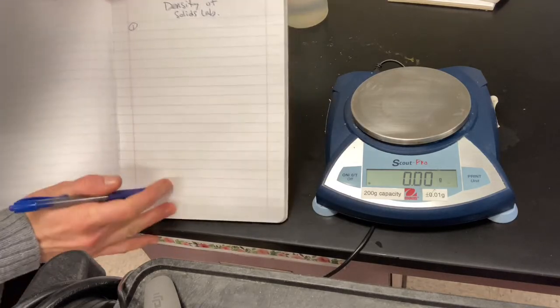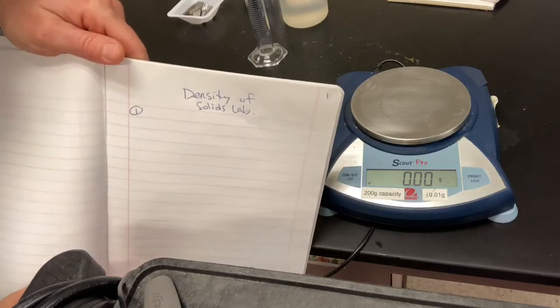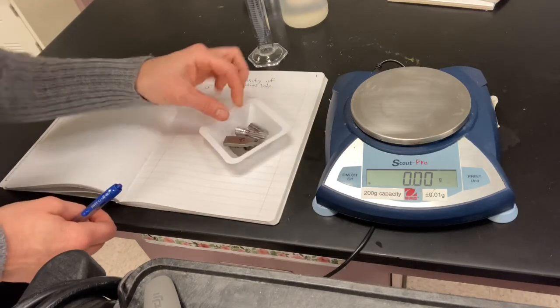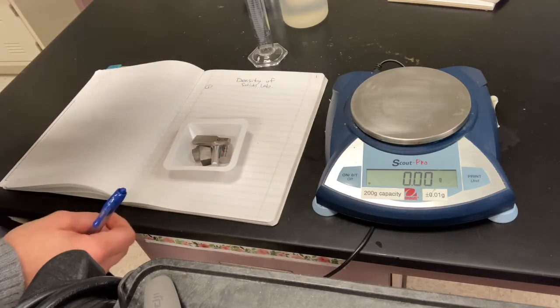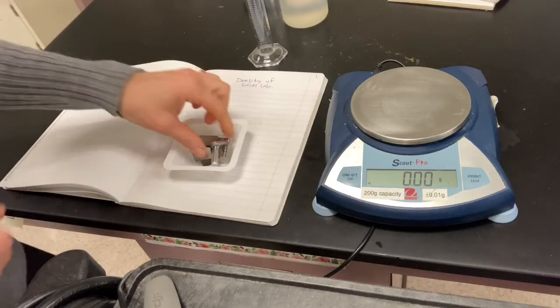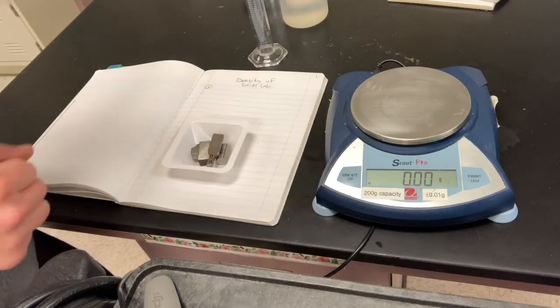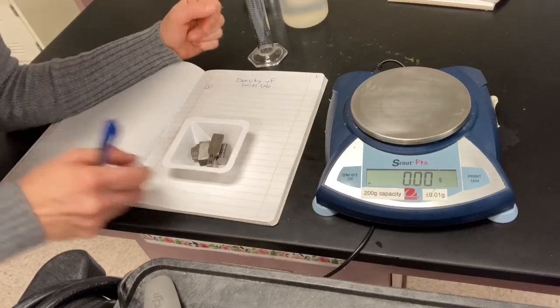So we're going to do our density of solids lab. We are going to look at a couple of things with some metal samples. I have a little bucket of metal samples here, and I know exactly what they are, but I'm also kind of afraid I don't. I'm afraid they might be something called alloys, which means they're a little bit of a mixture. So I want us to find their different densities and see if they're as pure as I think they are. So that's the way we're going to run this one this time. Purely a kind of quality control sort of a lab, okay?